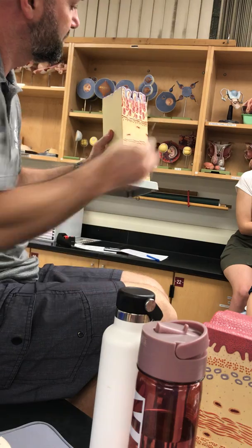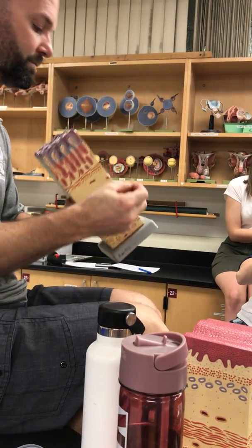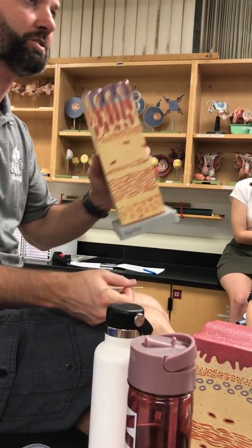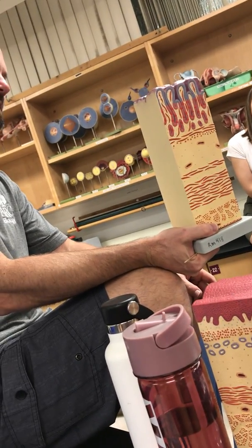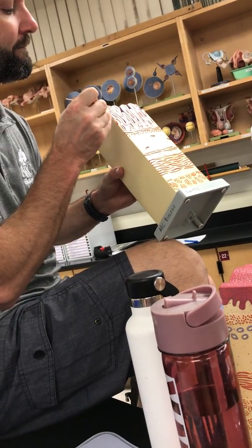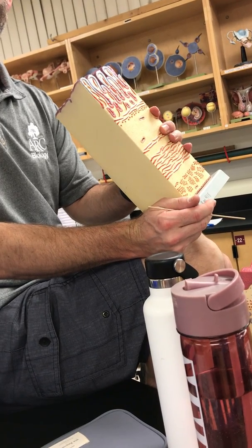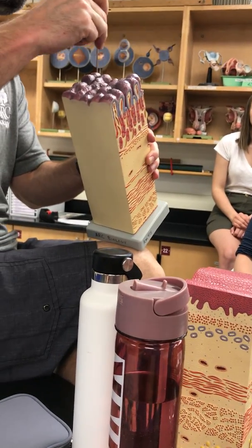These red cells, right? So the chief are way more abundant. So the chief are the lighter color, the smaller cell. Parietal? Parietal. Yeah, those larger red ones are parietal. Aside from parietal and chief, what would you find near the bottom of the pit, the gastric pit? The ECL cells. Mucous neck cells. Oh.